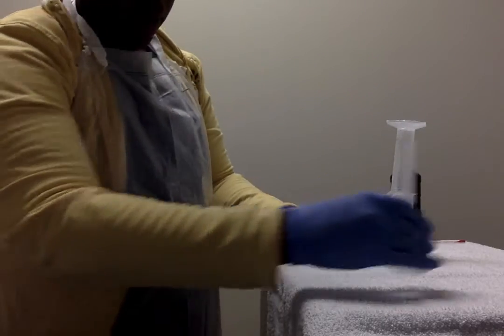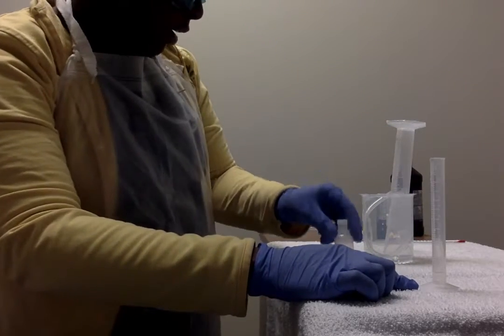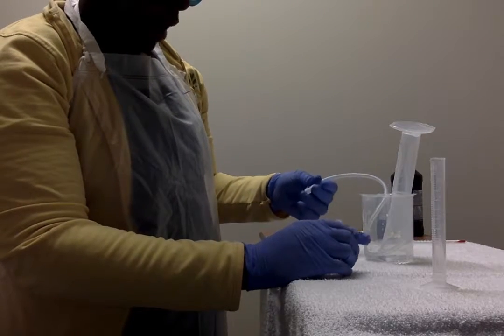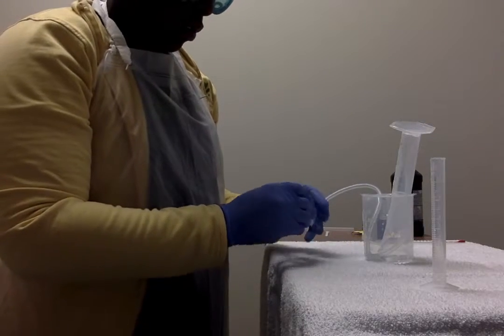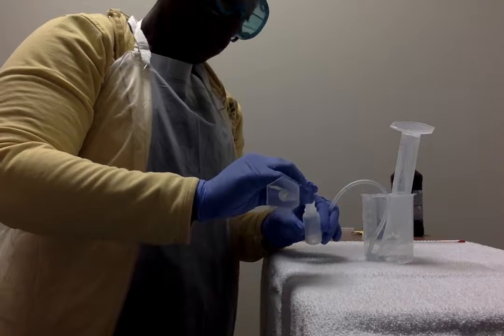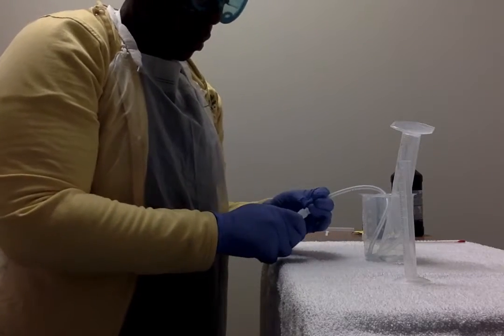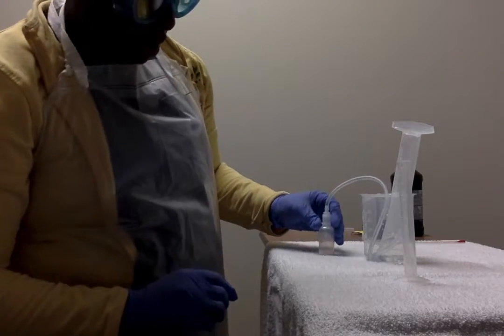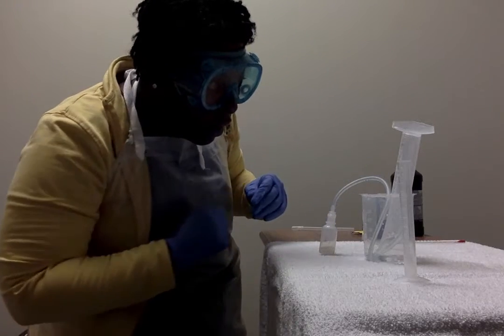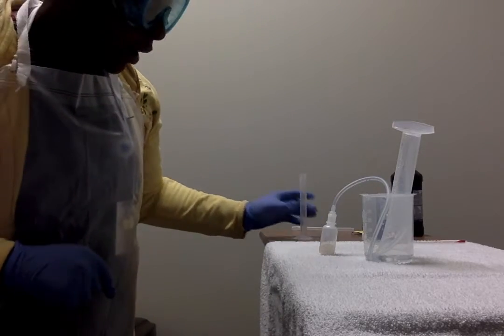Now, we're going to combine the 1 milliliter of hydrogen peroxide with the yeast. Then we need to be ready to put this cap back on it pretty swiftly. So I'm actually going to hold it in my hand while I'm adding it. And stick the top on that. And as you can see, there's bubbles here. Move this out of the way.